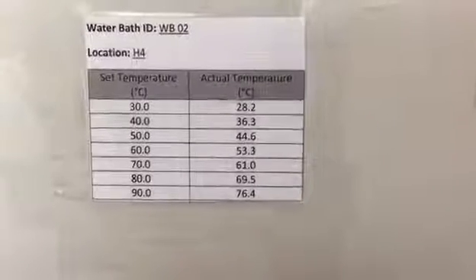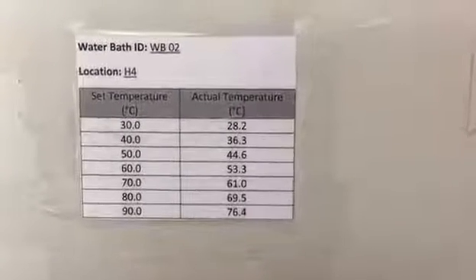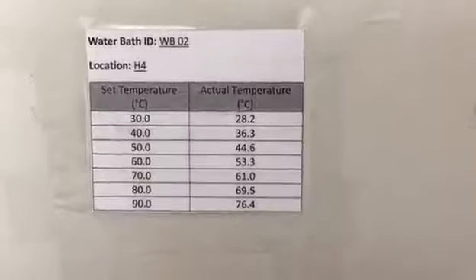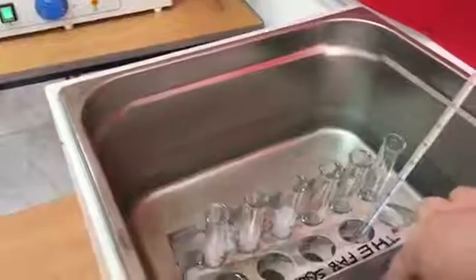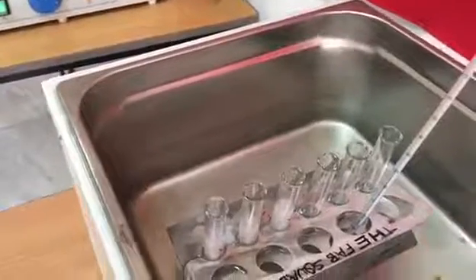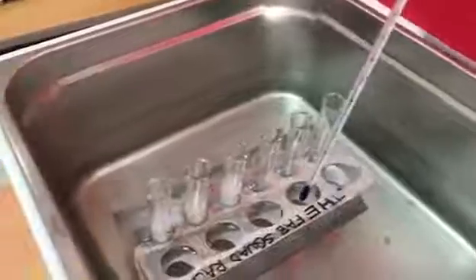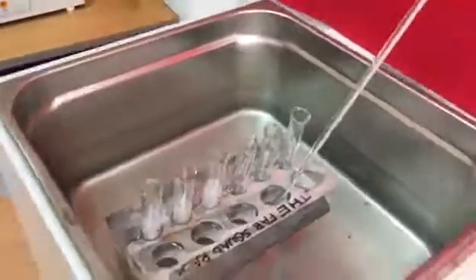Don't forget to actually check that the temperature of the water is the same as what you want by using a thermometer. Don't just stick your hand in or assume, because you'll waste time.